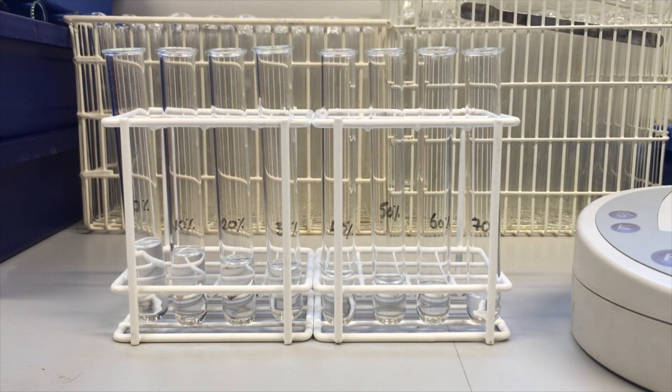What I have here in front of you is a series of test tubes with different volumes of water already added, and I've labeled the tubes with the eventual concentration of alcohol we're going to have in those tubes. So the next thing for me to do is to add the alcohol to make all the volumes up to five centimeters cubed, and then we'll begin from there.